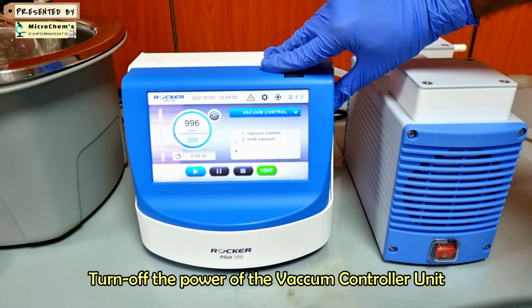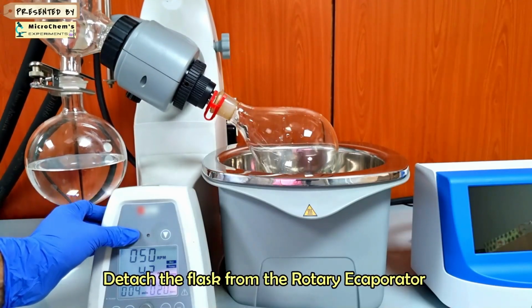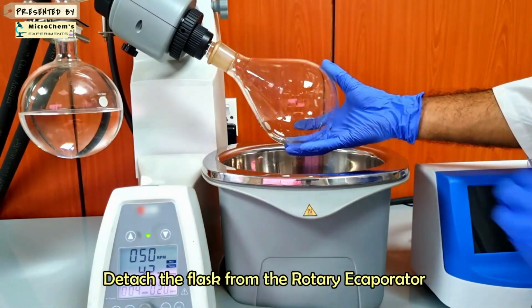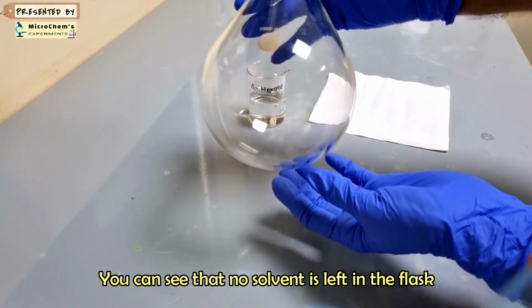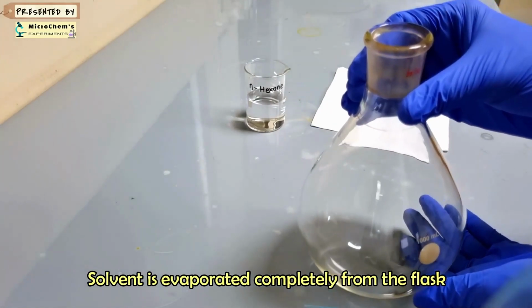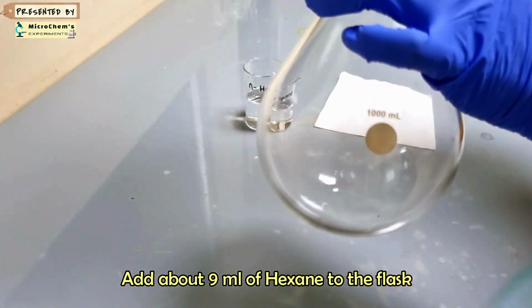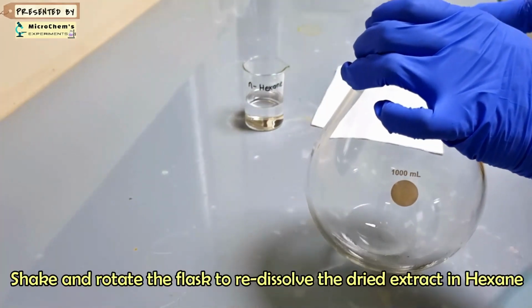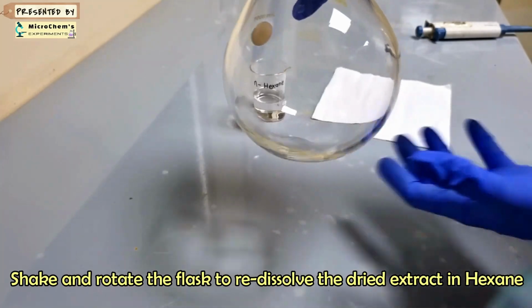Turn off the rotary evaporator setup. Detach the flask from the rotary evaporator. You can see that no solvent is left in the flask. Add about 9 ml of hexane to the flask. Shake and rotate the flask to redissolve the dried extract in hexane.